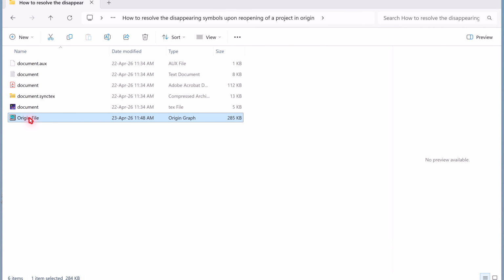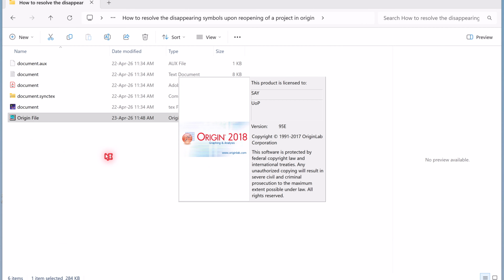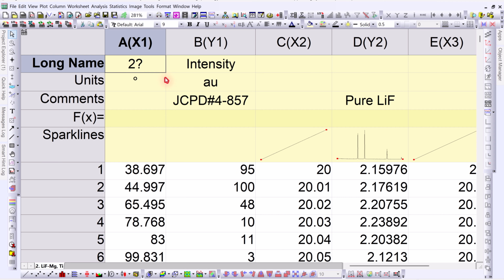Let me check it again. Now when I reopen the project, I can see that the symbol is gone again. So this is the actual issue. Now the solution is very important.